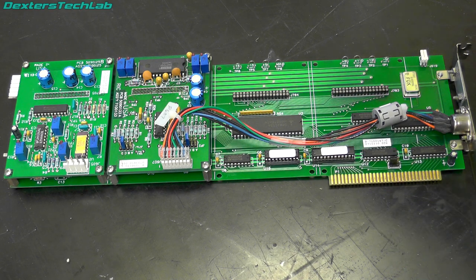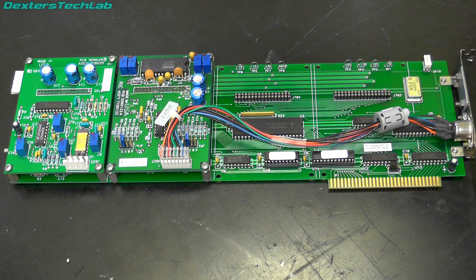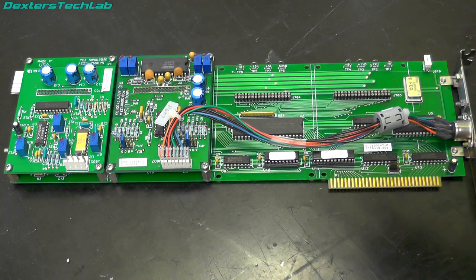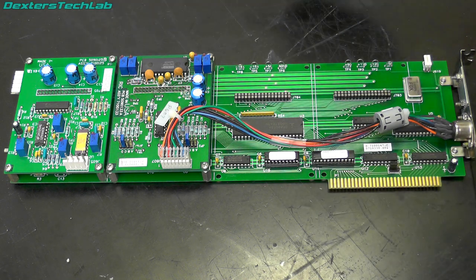This next card — I think we speculated when we took it out that it's some kind of digital-to-analog control system. It plugs into the ISA backplane so it's addressed by the software, and there are four module slots with up to four modules possible. I would imagine it's addressable and you can command various control voltages to go out to things to control or switch them to operate the rest of the machine. There are only two modules installed.